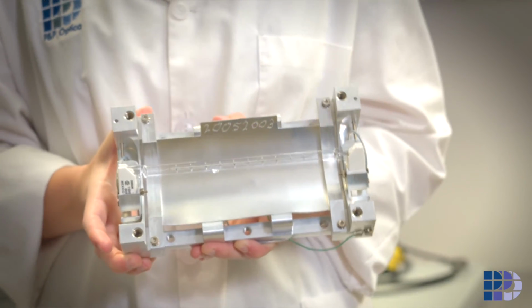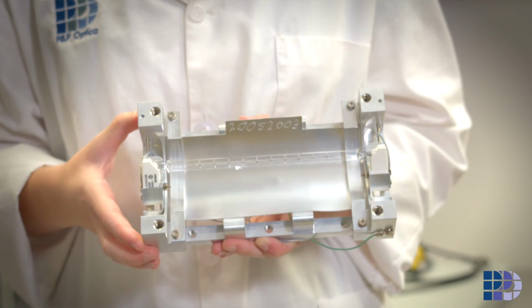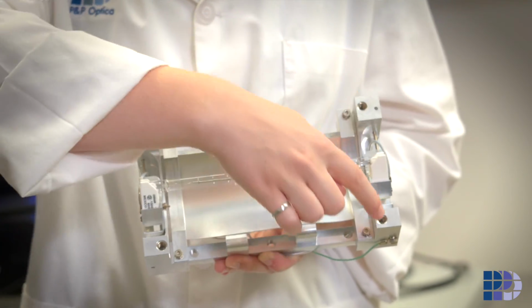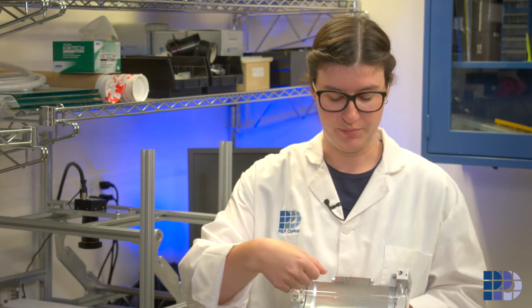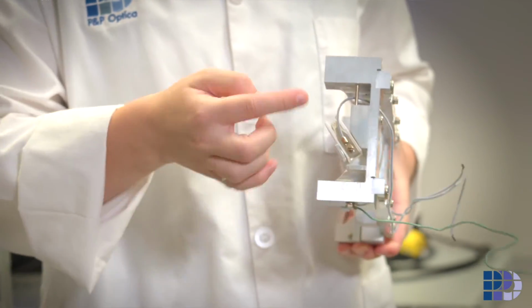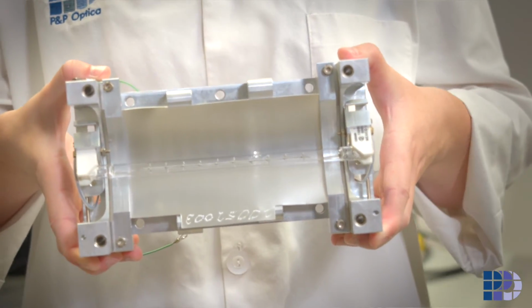Finally, the lamps have also been designed to make bulb changes as easy as possible. The window assembly can be removed from the back cover and the reflector assembly by removing the 4 screws from these threaded holes. And then the bulb becomes easily accessible and can be swapped. It's worth noting that the bulb change will not affect the bulb alignment, so swapping one bulb for another will result in the same identical lighting profile. Once the lamps are fully assembled, they're ready to be put on the system, and once that's done, your illumination for the system is ready to go.